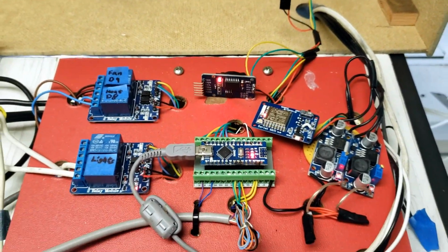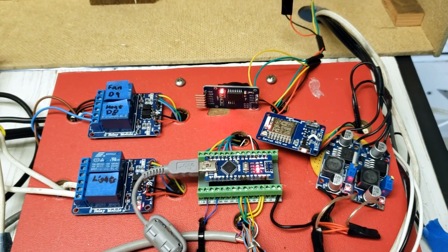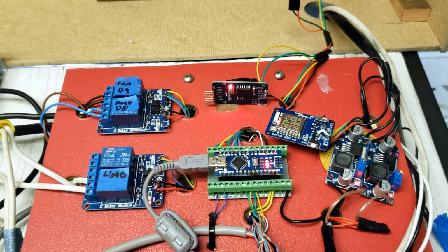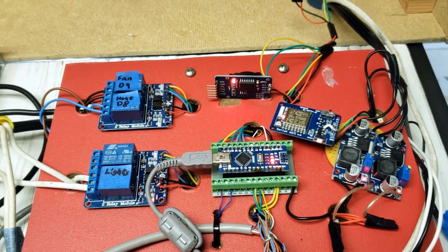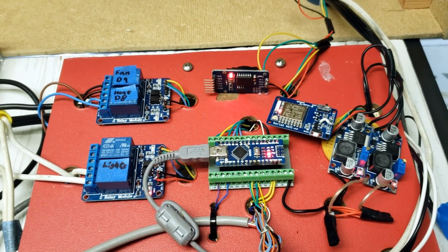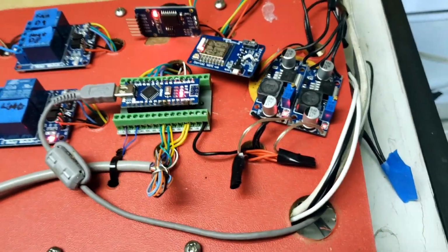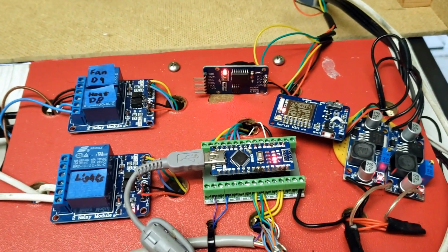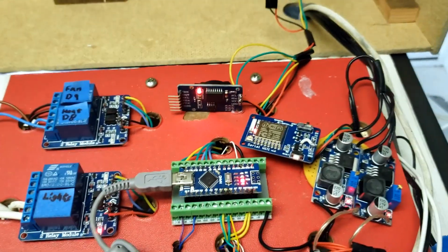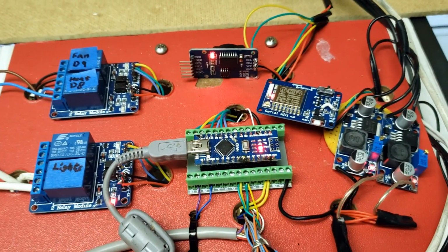What's going on with this big red board? So at the heart of this whole thing is an Arduino Nano, and that's what's providing the logic control, the sensor reading, all that. This is the gem of this whole setup, at the heart of everything, really. And it's detachable, so if something goes wrong and I fry it, I can pop it out. That was done on purpose. Ask how I know how to do that, or why I do that, I mean. I've burned up a few of those in my time.